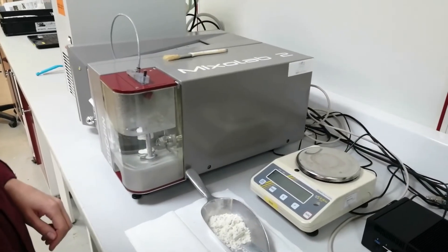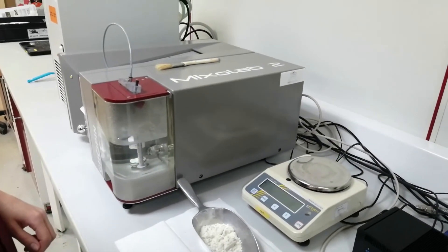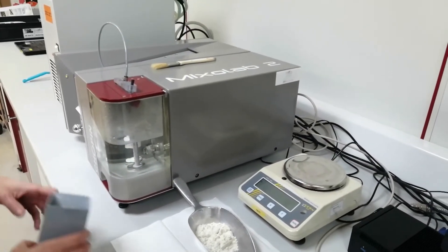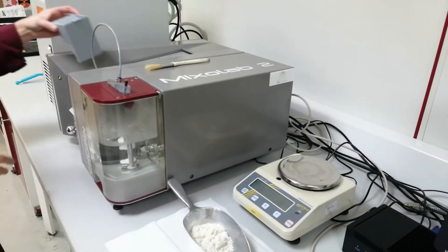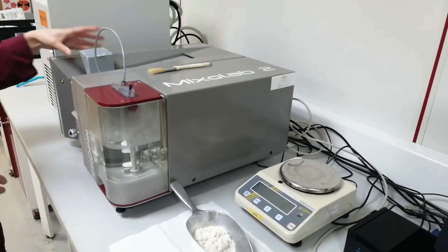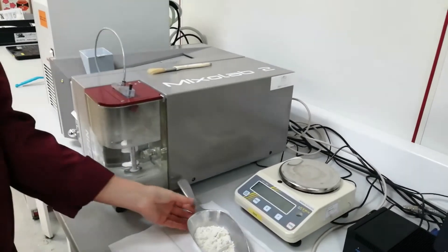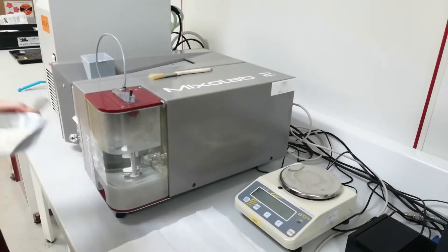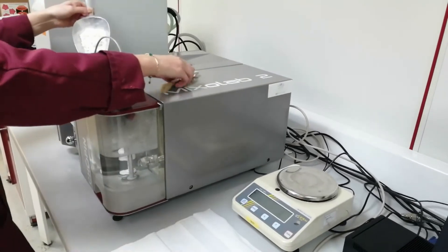When a message asking the user to add flour appears, you are going to place the hopper on the top of the mixing bowl and gradually add the flour to the hopper.